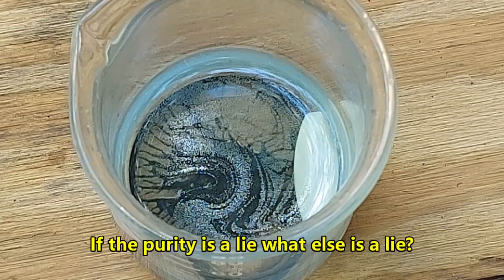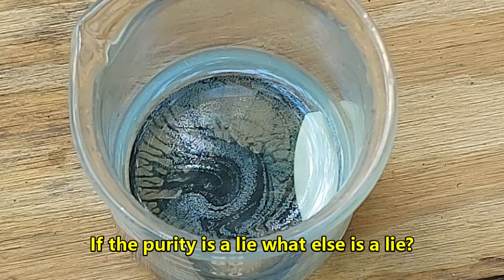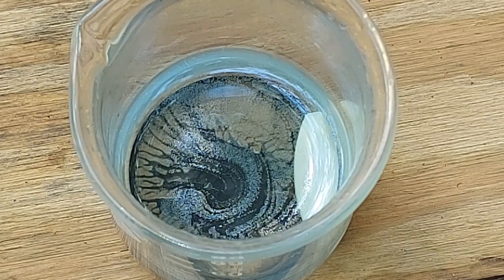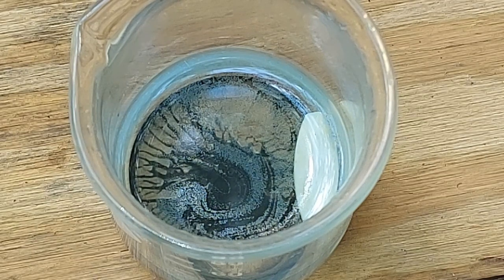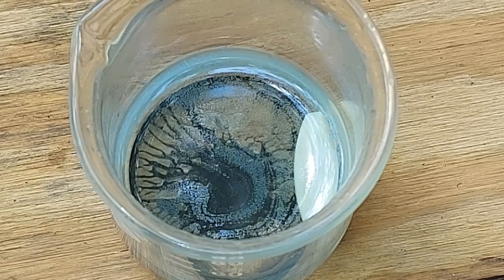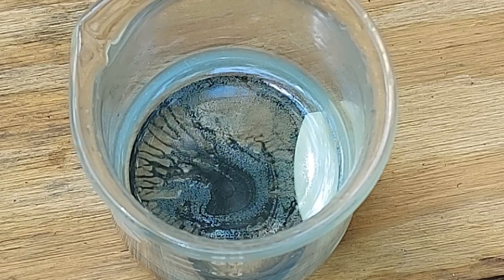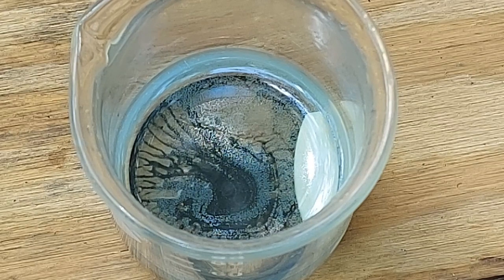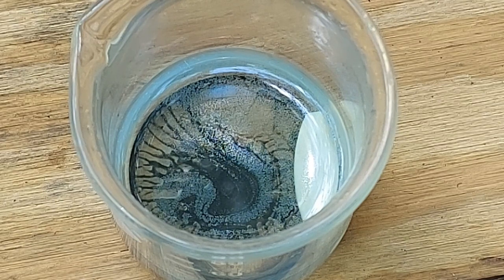And when I contacted the vendor about this, I said, hey, I just tried to dissolve what's supposed to be 2 grams of lutetium in HCl, and this is what I'm getting out of it. There's a ton of residue here that's just impervious to HCl. This is not lutetium. The guy comes back with, oh, well, you can't say that. You need X-ray fluorescence in order to be able to tell what element it is. And I'm like, okay. So this guy's trying to gaslight me on how chemistry works.